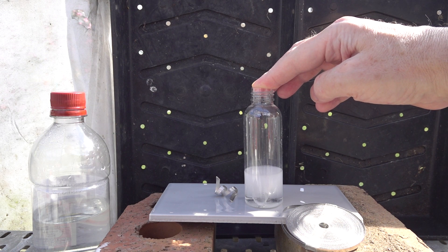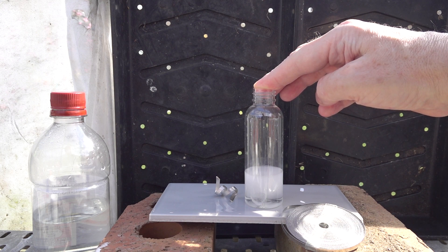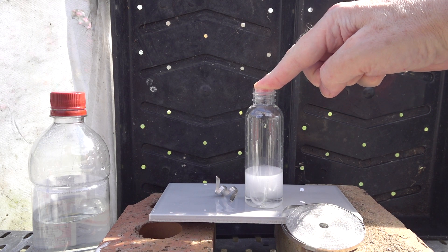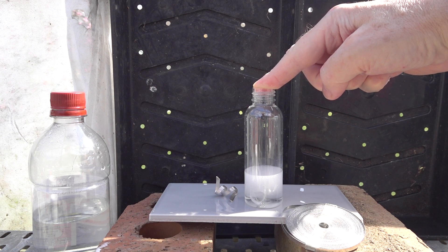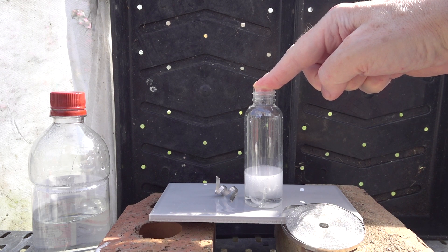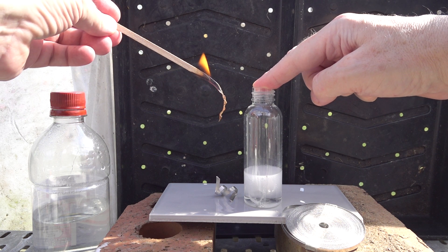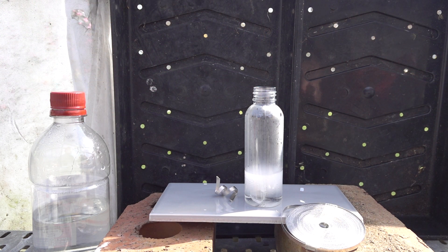What is the gas produced by the reaction of a metal like magnesium in acid? Well, we can test the gas with a lit or burning splint. So here's the gas. What gas is that?